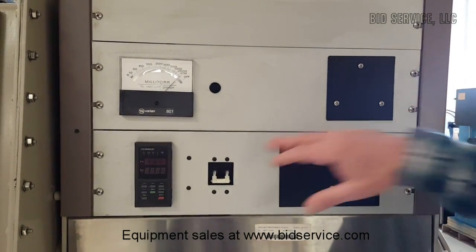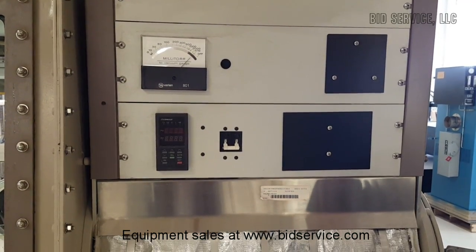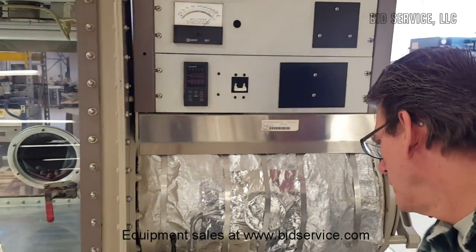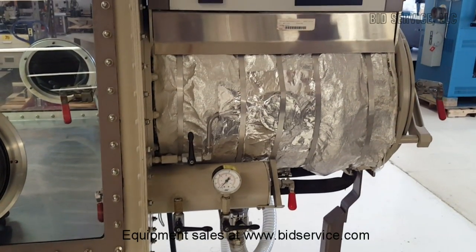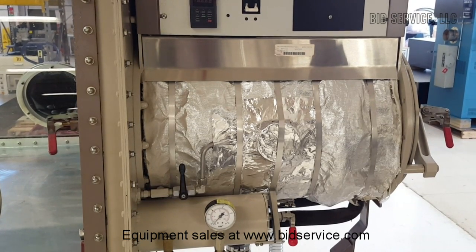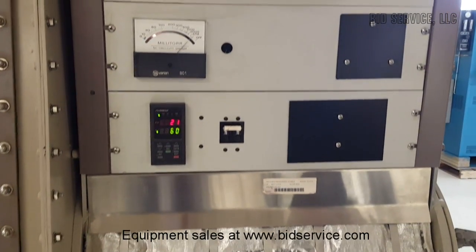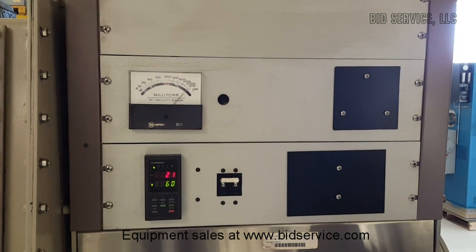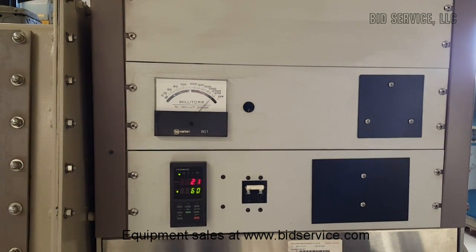As explained, as long as your power is on, your vacuum gauge will be working. It's at atmosphere right now. For transferring work in, it's recommended that you do three cycles — evacuate, purge, evacuate, purge. To evacuate, open this valve down here. You'll hear a burst of noise through the PVC pipe as you're evacuating this larger chamber. You can turn your heater on at this side and let it heat up to 60°C. It will pull down to about 500 mTorr or all the way to 30–35 mTorr if you give it enough time.